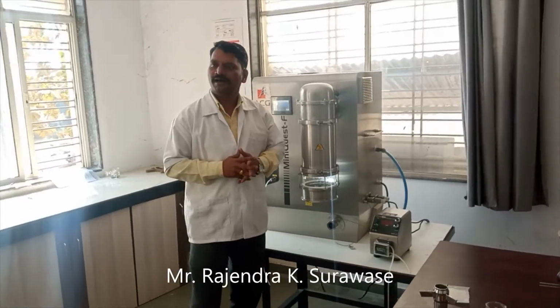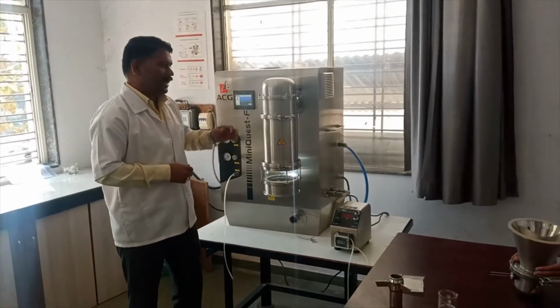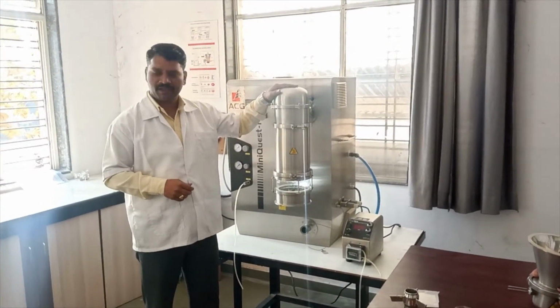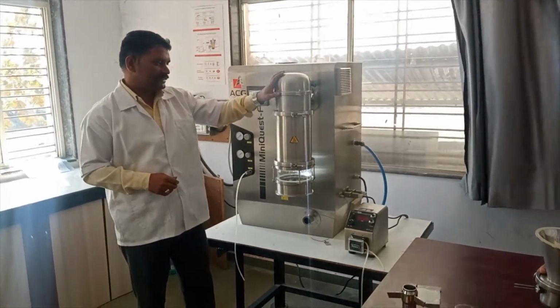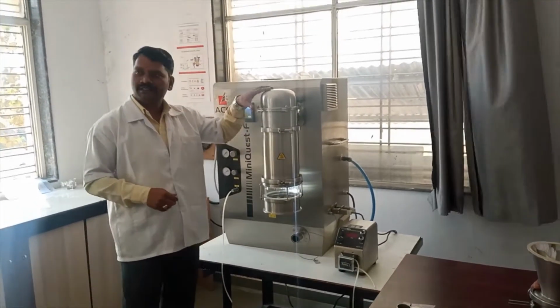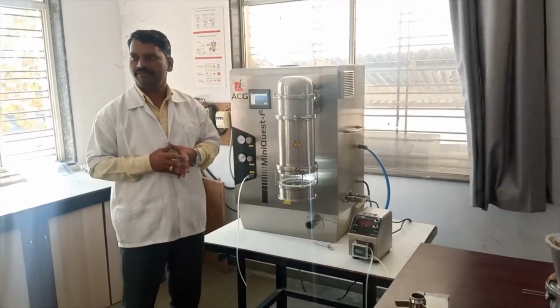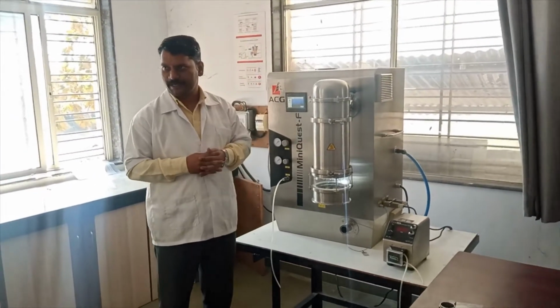Hi everyone, today we are going to demonstrate actual drug layering on sugar spheres. So before starting the actual demonstration, let's see the requirements for this practical, that is, the formulation of a controlled release drug delivery system by using a fluidized bed processor.